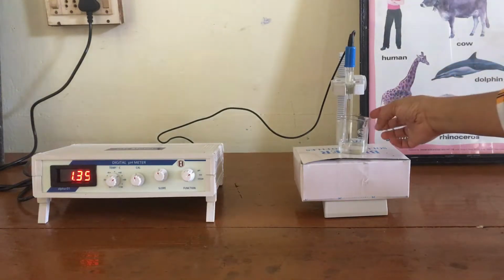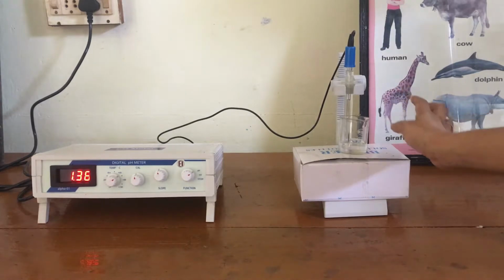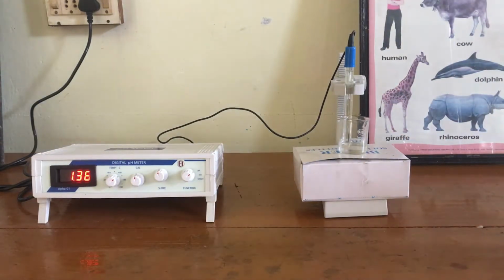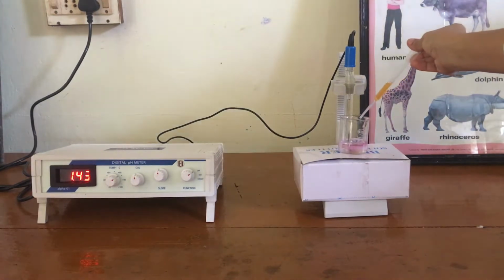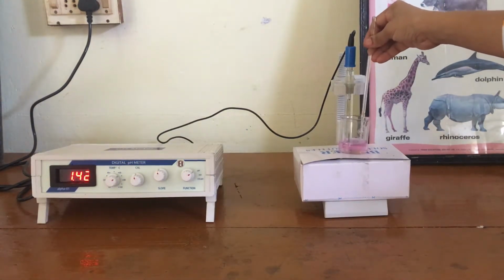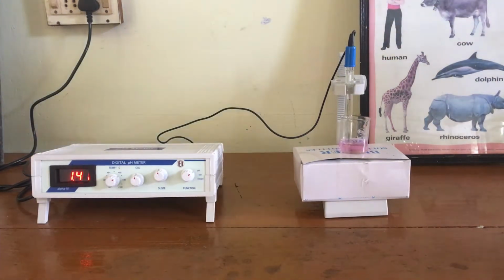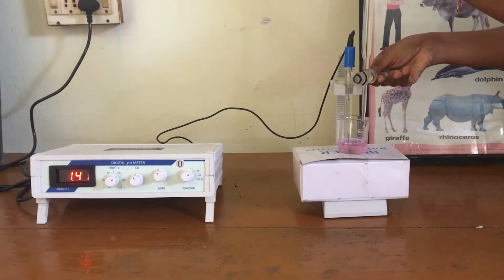Here we have a calibrated pH meter, and also in the small beaker we have taken one normal 10 ml glycine and one normal 10 ml HCl solution. And to this I am going to add thymol blue indicator. After adding thymol blue indicator, we need to stir the solution and note the initial pH value. Then after that we need to add 1 ml of one normal NaOH solution sequentially until we get a pH value of 12 in the pH meter. So, after adding each 1 ml of NaOH solution to this beaker, we need to stir it and record the pH value displayed in the pH meter.